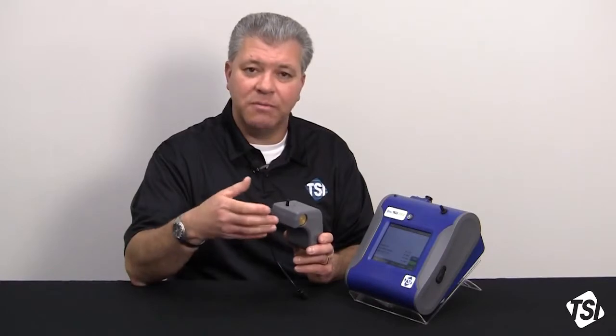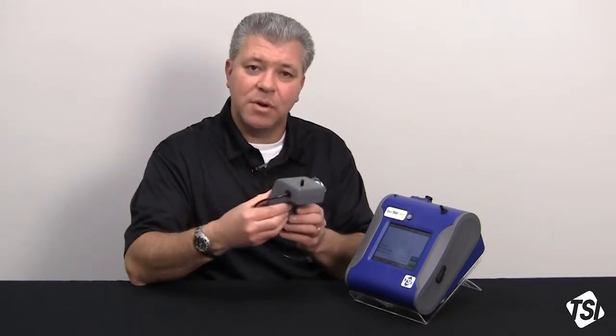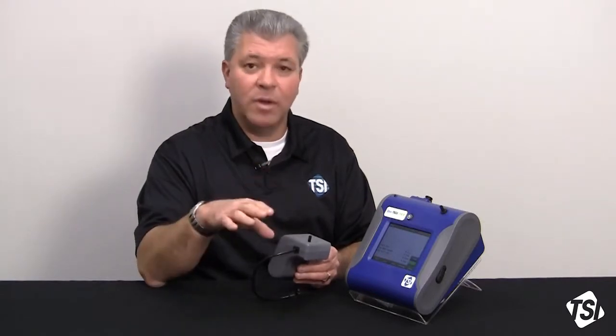If you're doing that at less than a 2-minute log interval, you may affect more than one data point. We're trying to affect the least amount of data points possible. A 2-minute interval will ensure that only one 2-minute data point will be lost and show up as zero data. If you're concerned that doing it every 2, 3, 4 or 6 hours means these zero data points are going to affect your data, it will not.